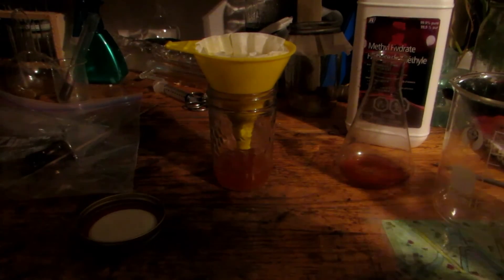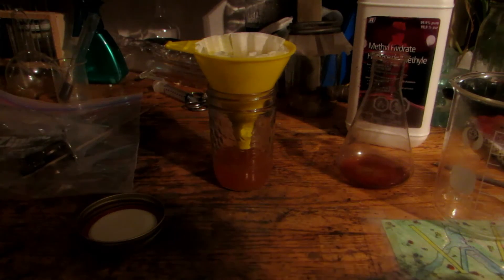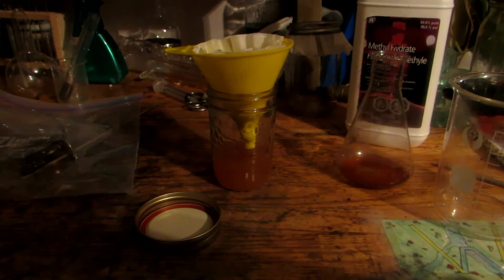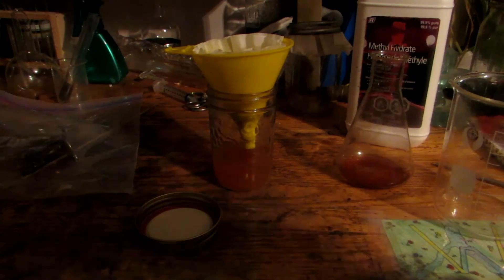We'll do one more washing just to make sure that we have nice clear ammonium chloride crystals and not that ugly brown color. Although methanol isn't extremely expensive to buy by any means, so if you do just keep purchasing it, it should also be okay. We'll just let that finish filtering off and we'll see what type of crystals we got. Because we did use methanol which has a fairly low boiling point, this will evaporate fairly quickly in the air, so you must store it in an airtight container such as this canning jar. But the other benefit of that is that our crystals are going to dry very quickly as the methanol will rapidly evaporate out. We'll put these off into a separate dish to dry and put a cap on our methanol solution.